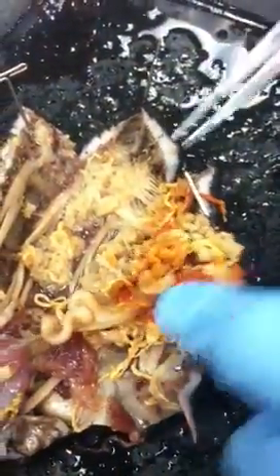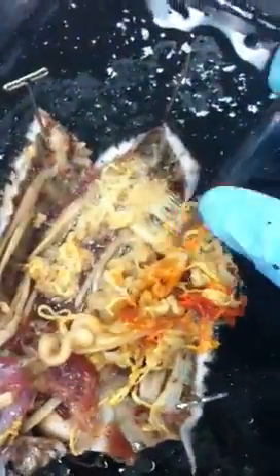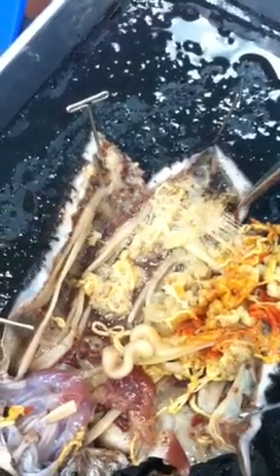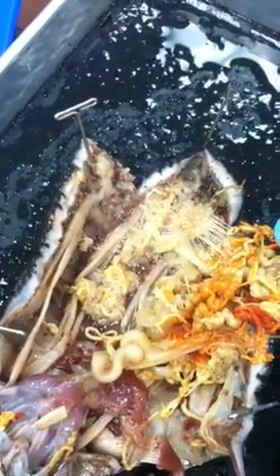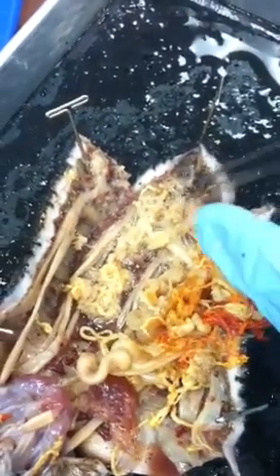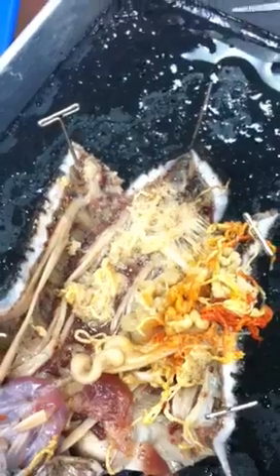So the food's going to go through the intestine, over to here, and end up at the cloaca, which is right here. Cloaca. It is right here. Okay. So then the food is going to go out of the cloaca through the anus, just like a normal digestive system.